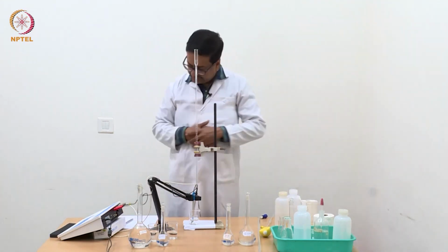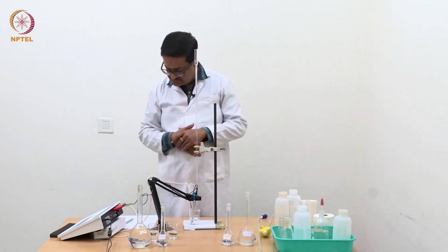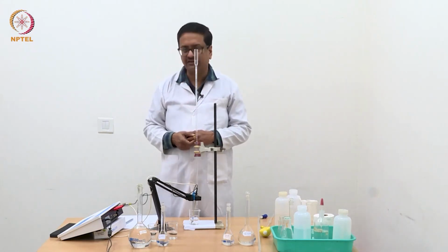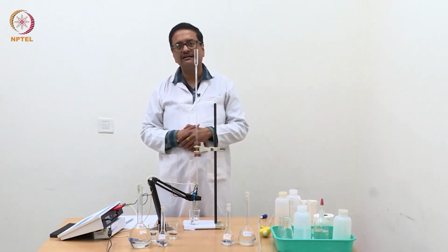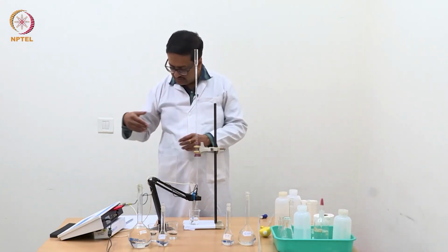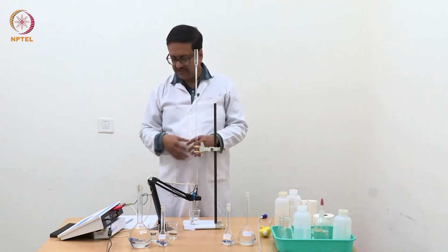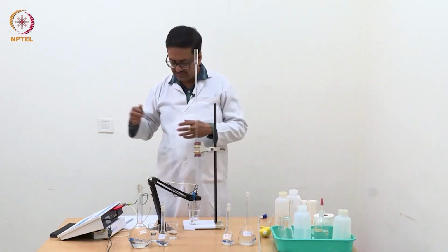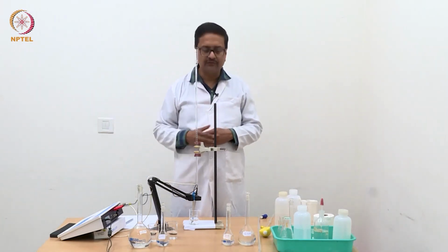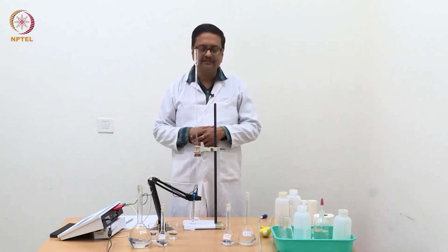Now we have added up to 0.8 ml and the conductance that we have reached is 0.632. So we are still decreasing in conductance, which indicates that the neutralization or equivalence point has not been reached yet, and we should continue addition of small amounts till we see an increase in conductance, which will show that the additional NaOH is responsible for the increase in conductance.